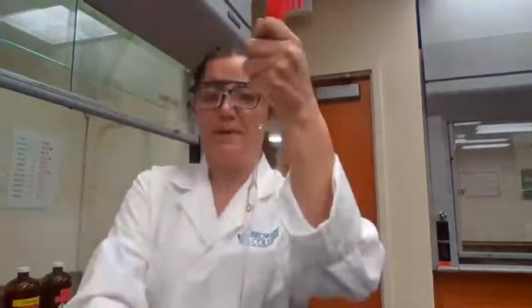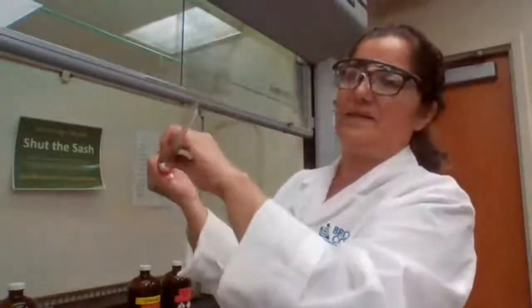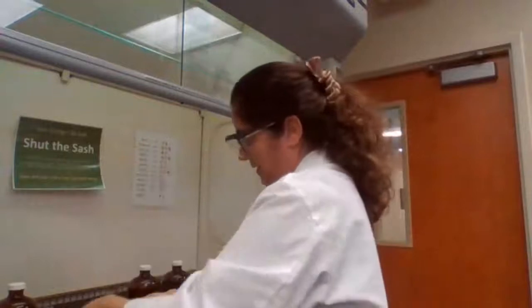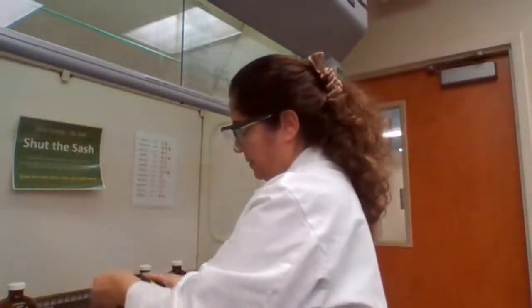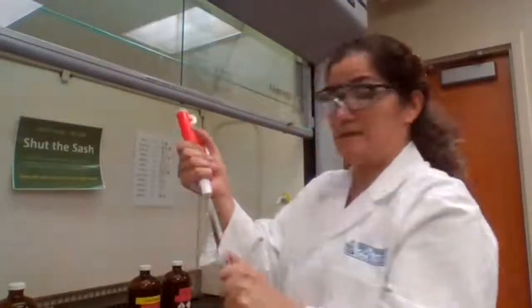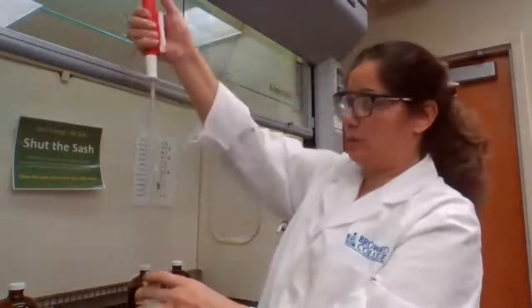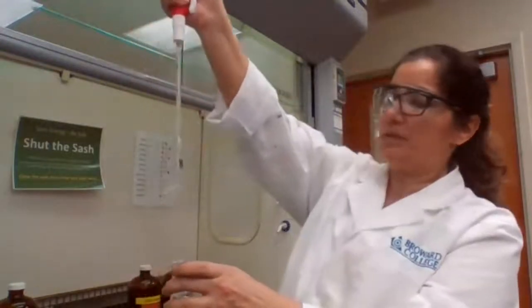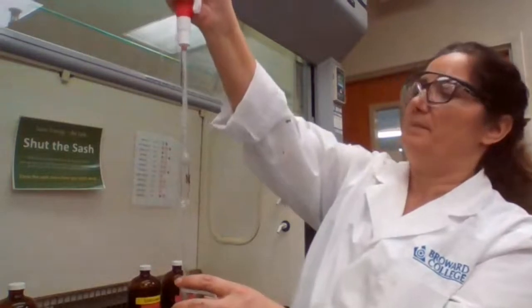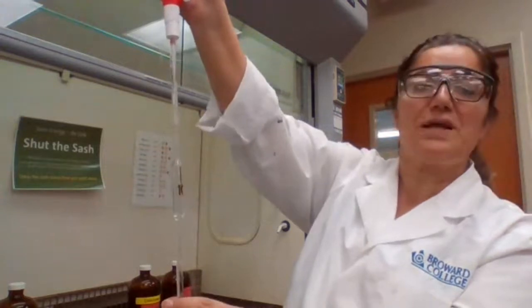We insert the end of the pipette into the pipette pump, and the tip of the pipette is going to be placed inside the unknown liquid in the beaker. Based on the design of this pipette, if you wheel down, you are going to pull the liquid in, and we pull the liquid in until it reaches this brown line, which is called the index line, and adjust it at that line.